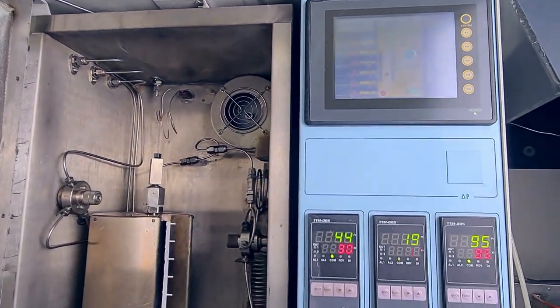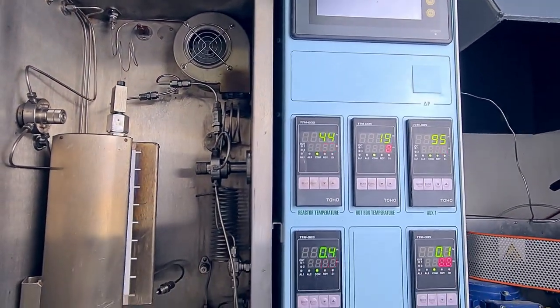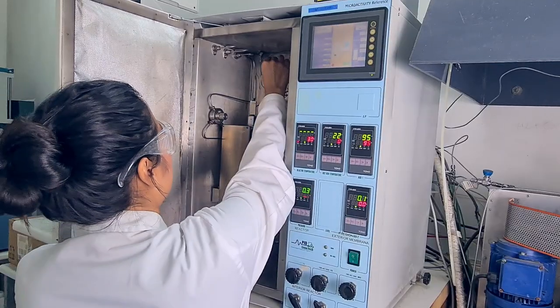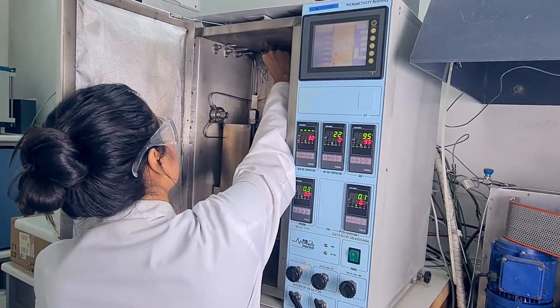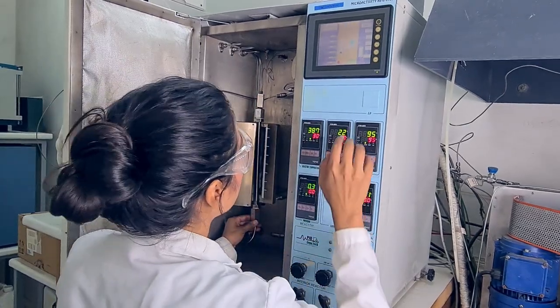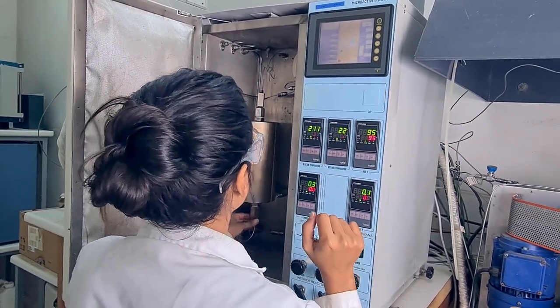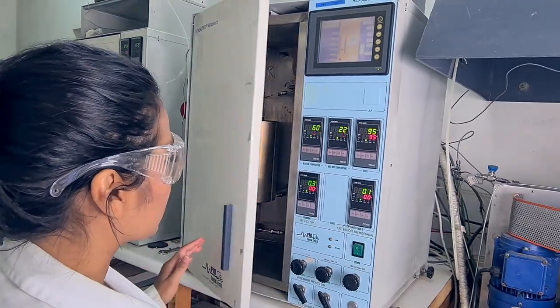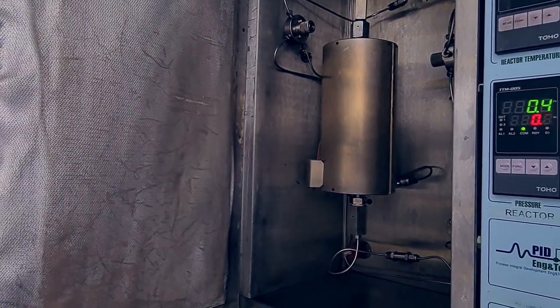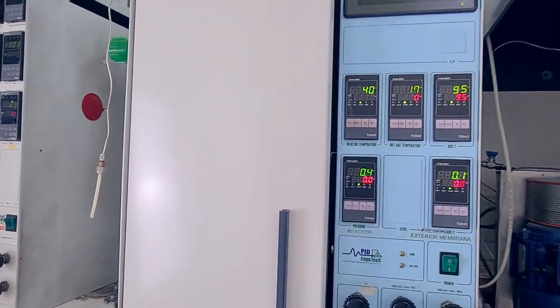This includes hydrogen and the mixture of reactant gases — hydrogen, CO, and CO2 — which are fed from top to bottom of the reactor. Methanol and water can also be fed by HPLC pumps. The temperature and pressure in the catalytic bed are also measured and controlled. The products are conducted to the analysis system and gas phase through heated lines.